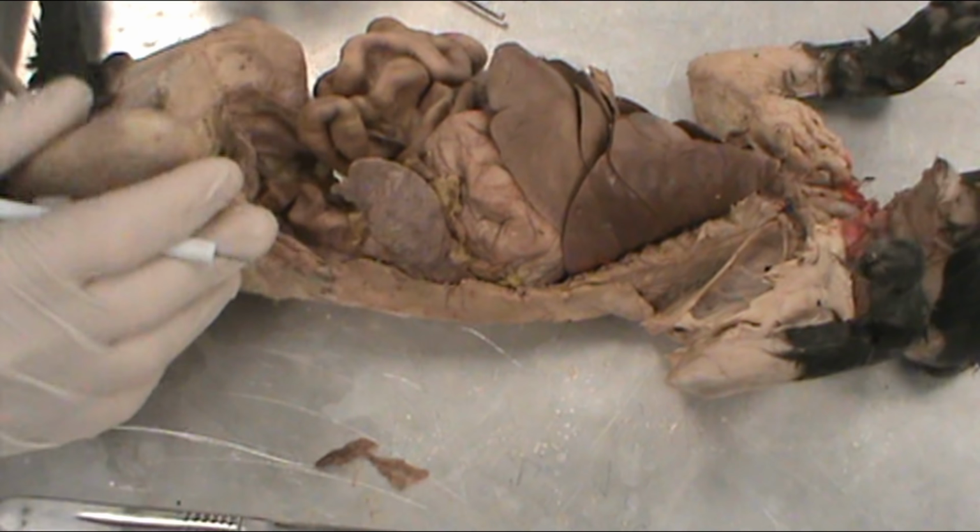I'm Mr. Agrippa, your anatomy teacher, and today we're going to be going over the final cat organ lab practical and all of the organs that will be on your list for that practical. So, warning right now, there will be some graphic cat dissection footage coming up, so just keep that in mind as you continue. All right, let's go ahead and get started here.